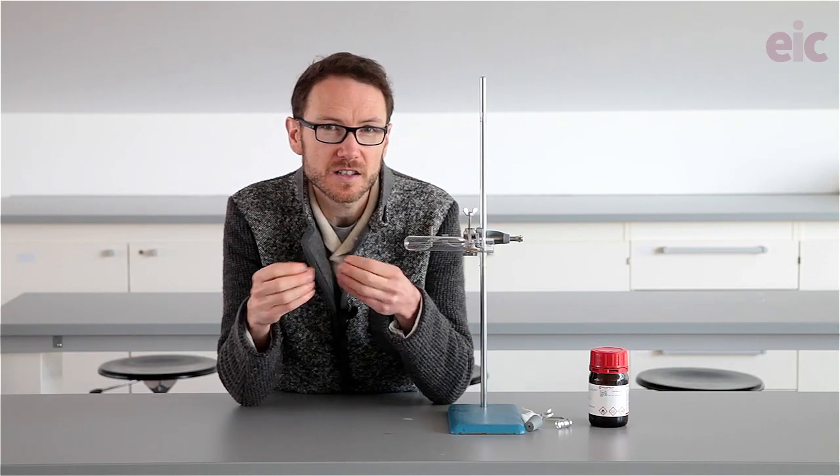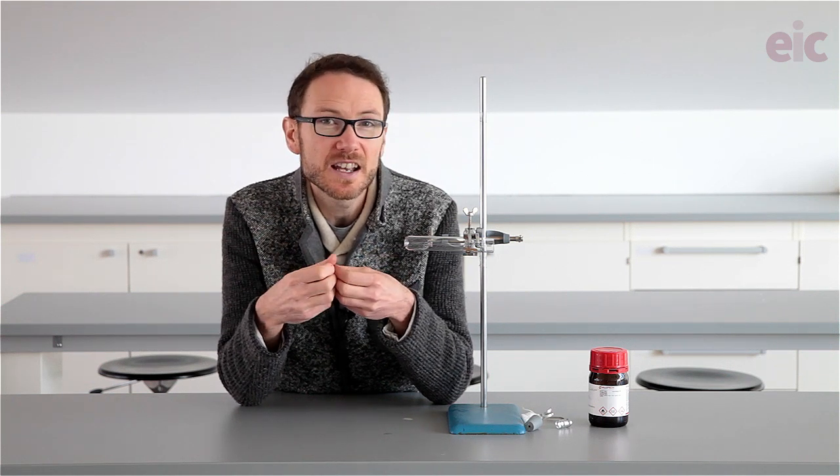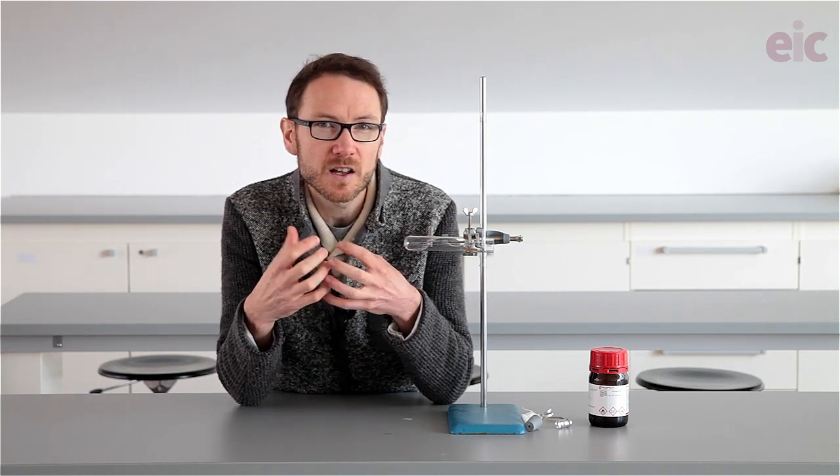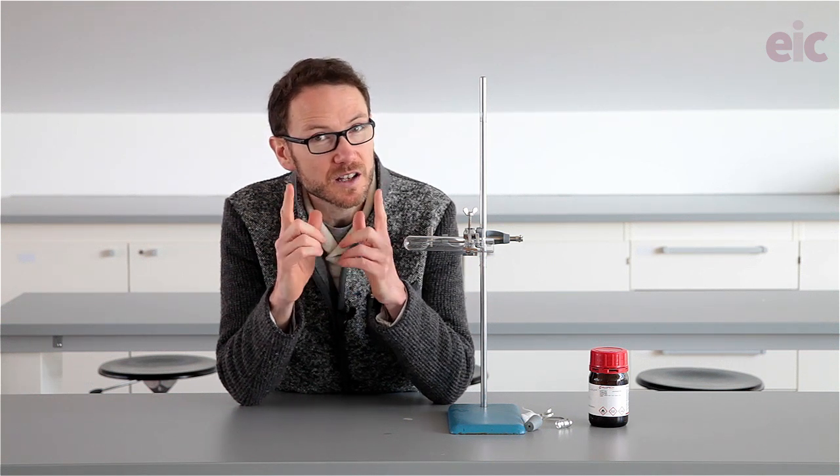One thing that I like to do to really strengthen this connection between the reactions with the water and the reactions with the acid is to explore in a little bit more detail what's going on with magnesium, and this is where the reaction of magnesium with steam comes into play.